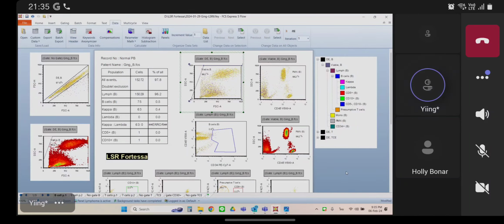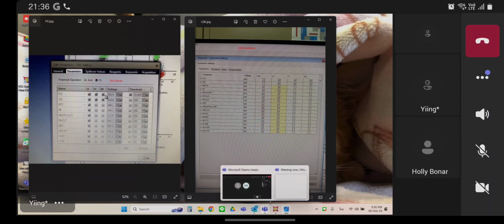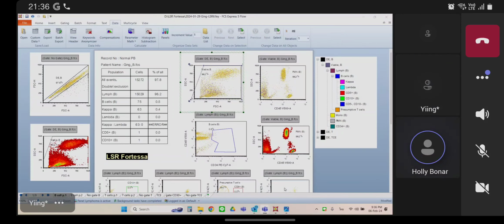Okay. From now on, I cannot save width, right? Say that again. I cannot save width, right? I would say going forward, you should not save forward scatter width. And I think as long as you do that, it will work. Okay, I will try to do something you teach me. And I will tell you later. Yeah, give it a try and see how it works, and then just let me know. Okay. So I think if you uncheck that width on your instrument and then export your data like that going forward, your layout will work.